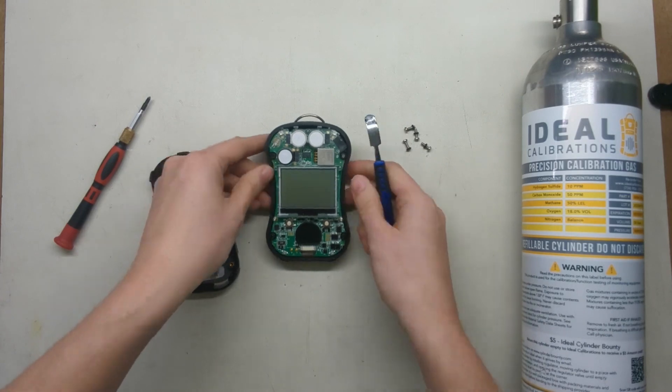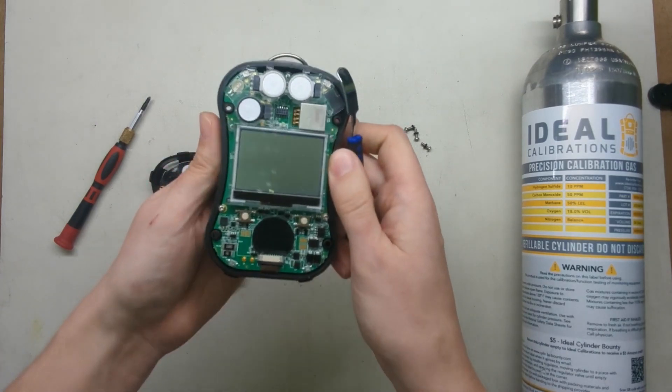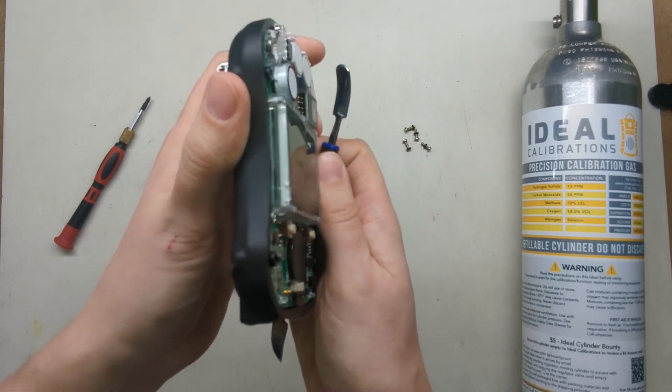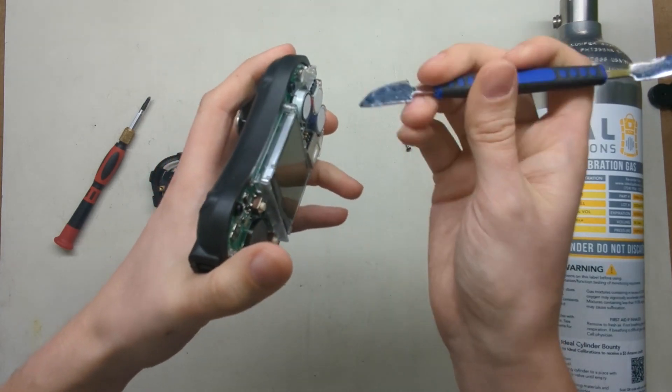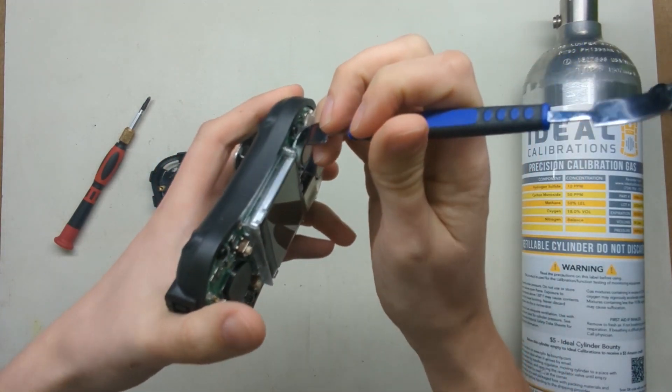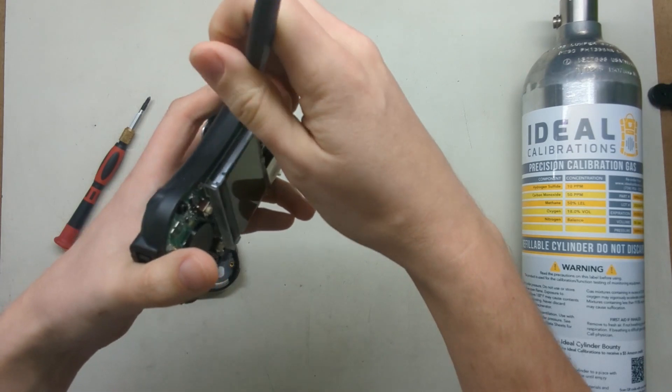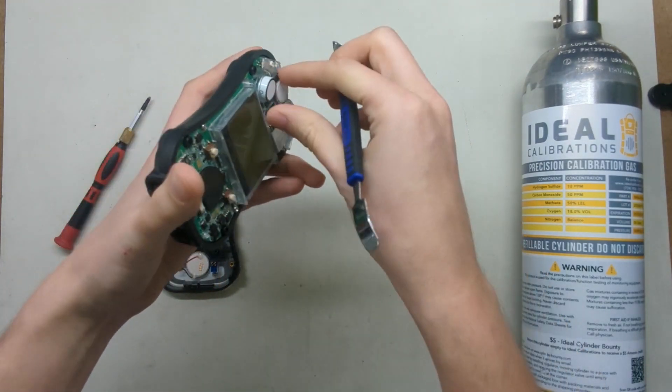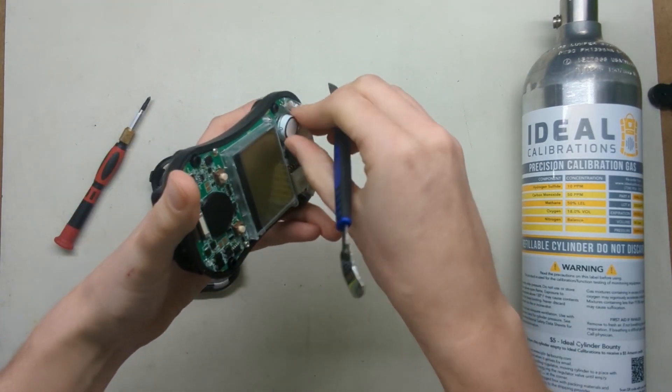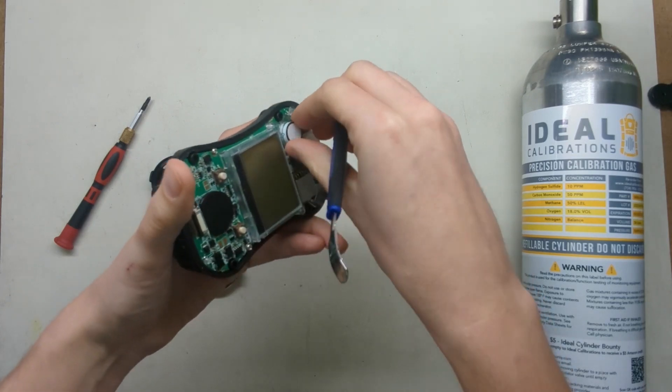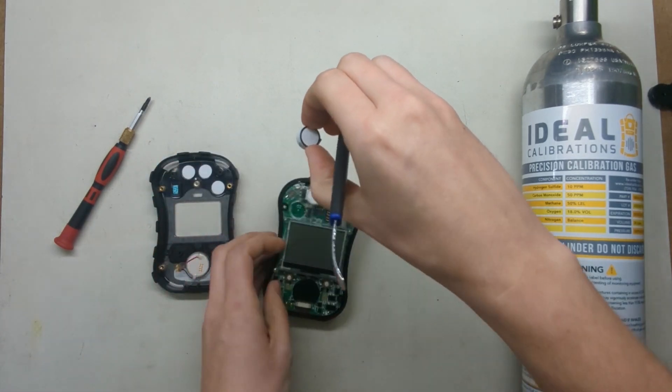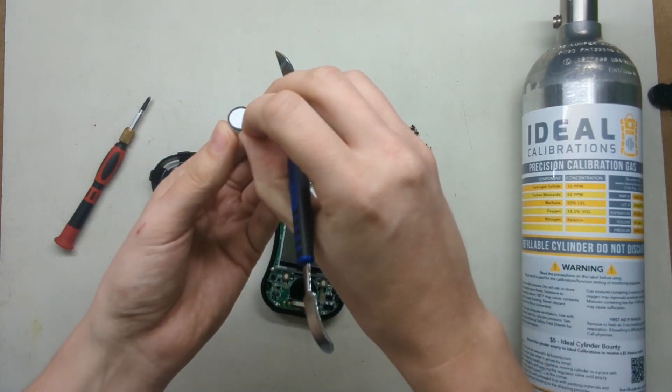Now it's a little bit difficult to pull out of here so you have to be pretty careful, but there's a little slot underneath over here and if you take a wedge or a flathead, be gentle with it and you just kind of pop it in there and then you can pull it out. Occasionally it'll stick a little bit more. Just be careful with it. Make sure that you don't do anything that's going to harm the top of this filter.